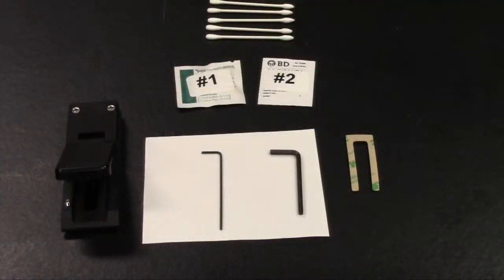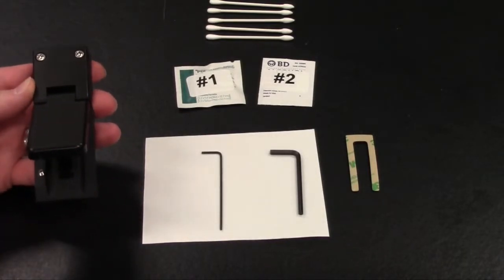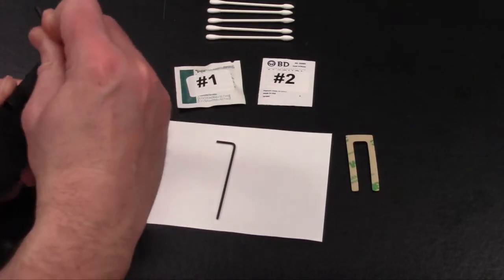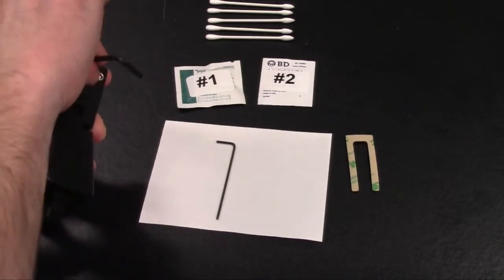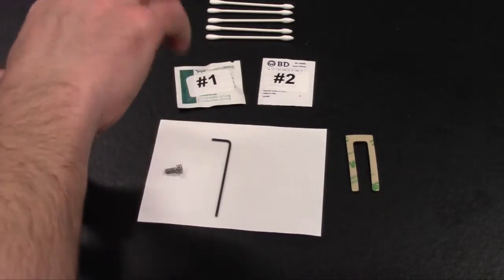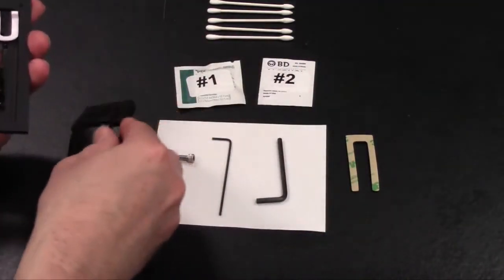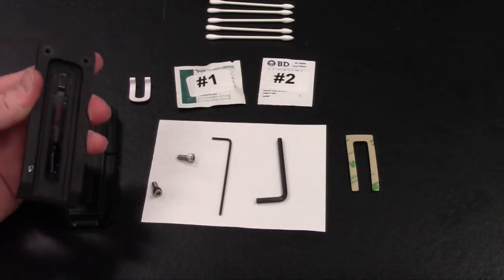Next, what we will show you is how to remove and clean the top slide assembly of the Easy Reader. What we will do is take the larger 9/64 inch Allen key and remove the top 2 screws from the lid of the slide assembly. And this will allow you to open up and remove the lid, and when you do so, inside you will see a white little spacer. So remove that, and we'll need that to reassemble the unit later.